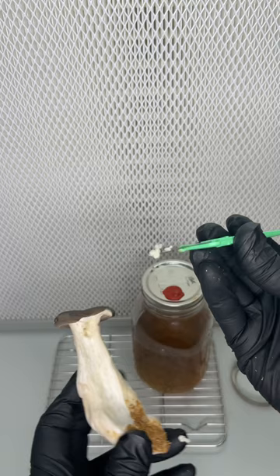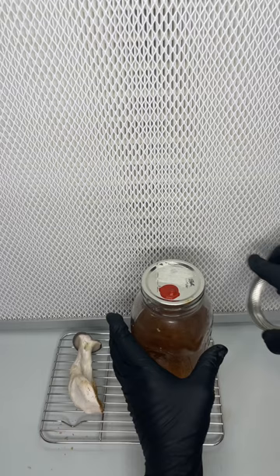The recipe is one tablespoon of honey in 600 milliliters of water, sterilized in a pressure cooker at 15 psi for 30 minutes.